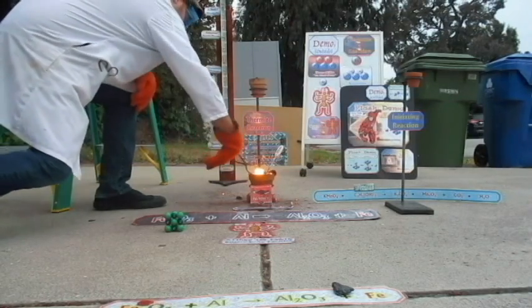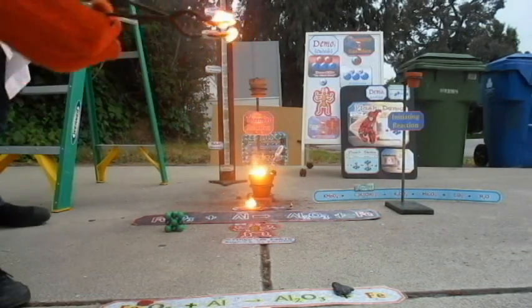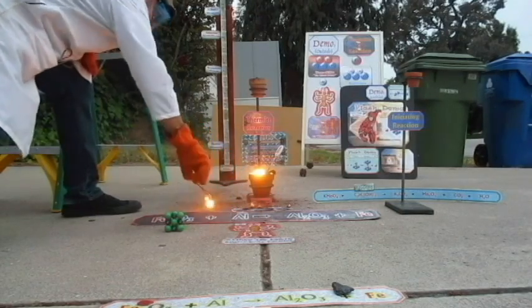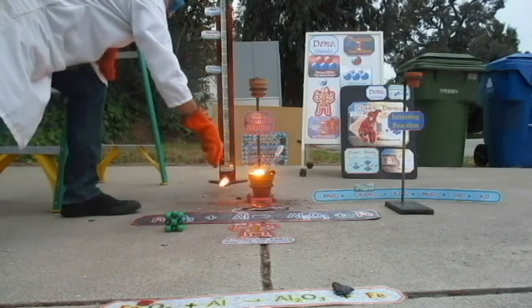Good. That was so cool. Look at how big this chunk is. Oh, wow, molten, right? Oh, it's burning up my papers. Uh-oh. Okay, I was going to see if it was magnetic. Oh, it's still molten. Here's a magnet. Nope. Okay, look at that chunk.